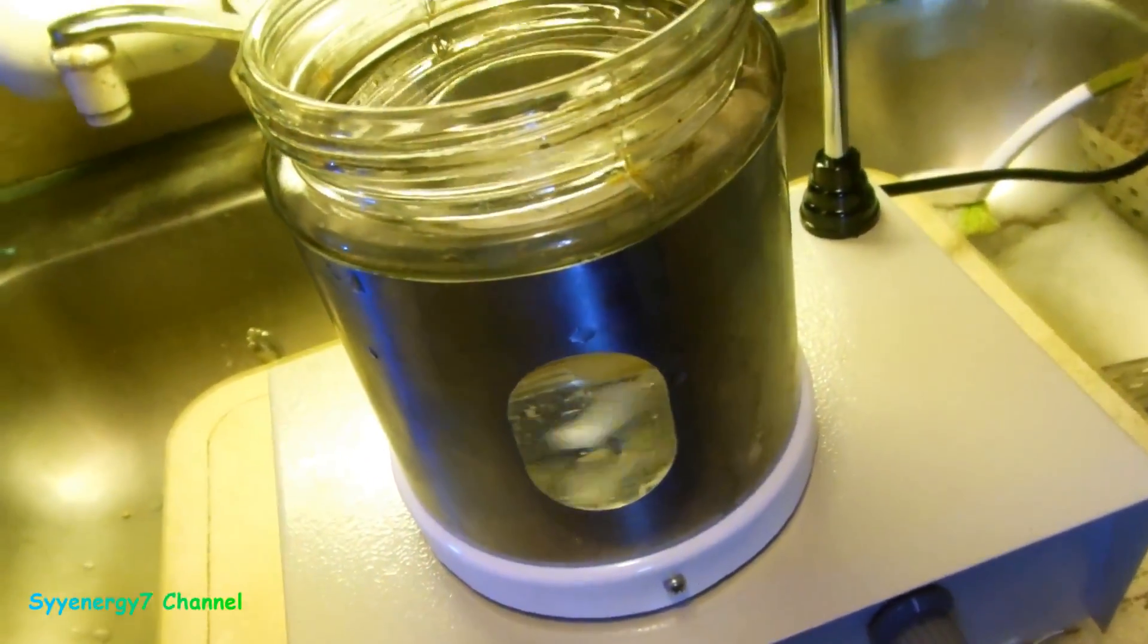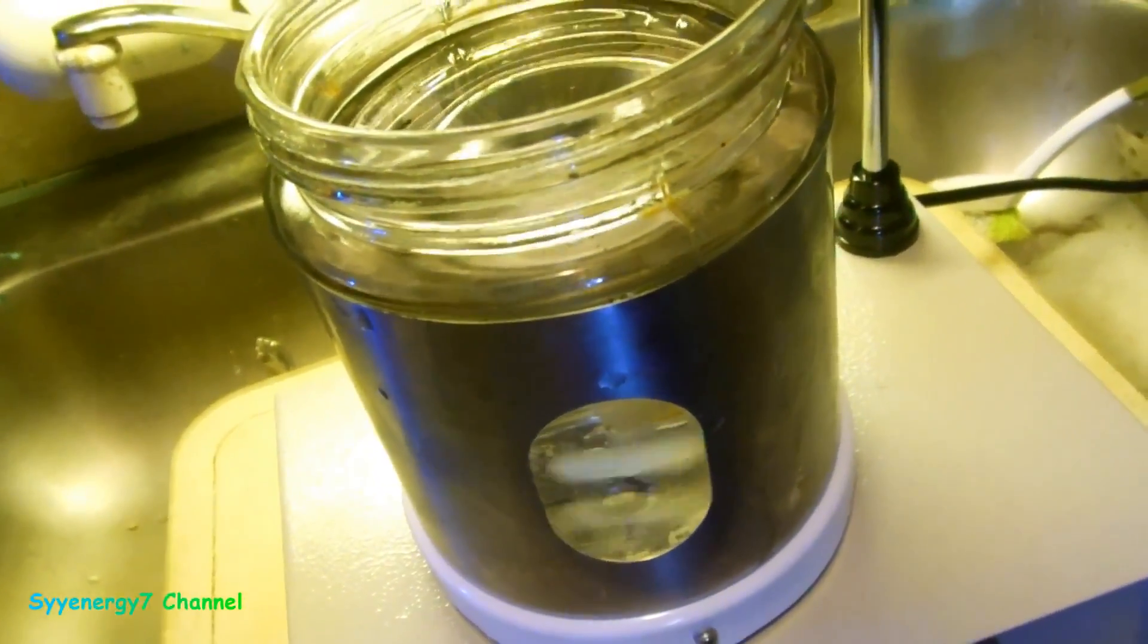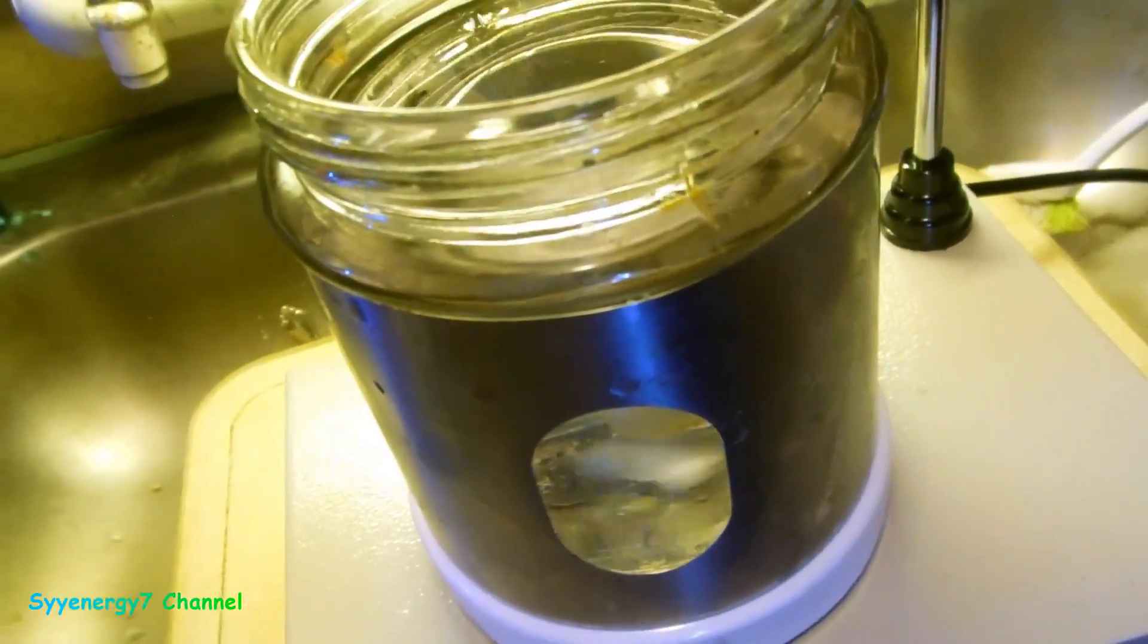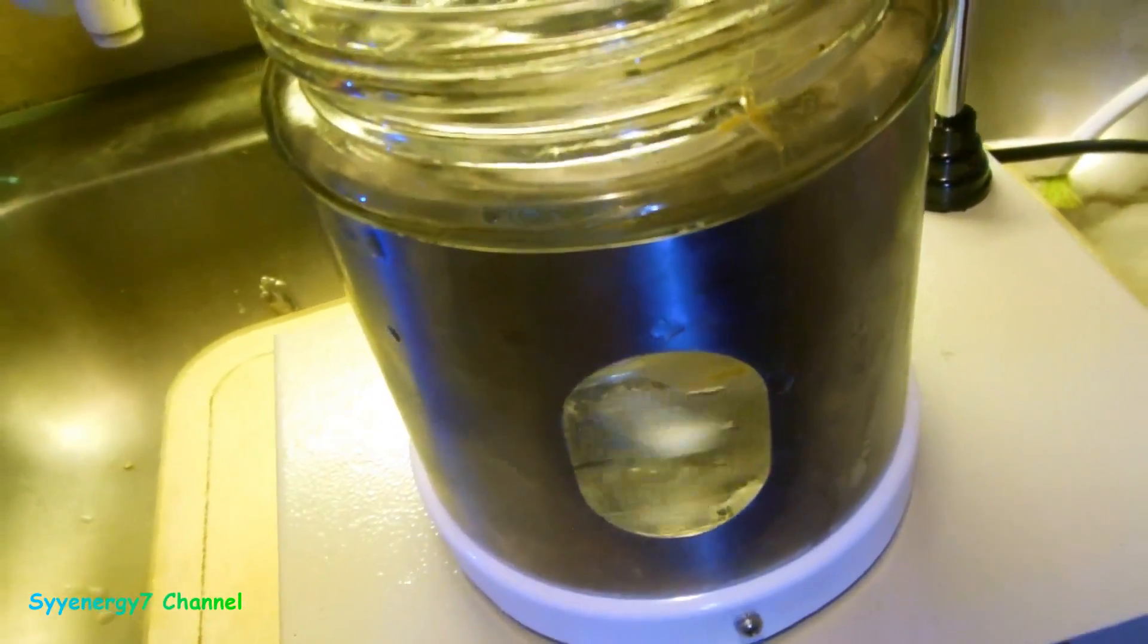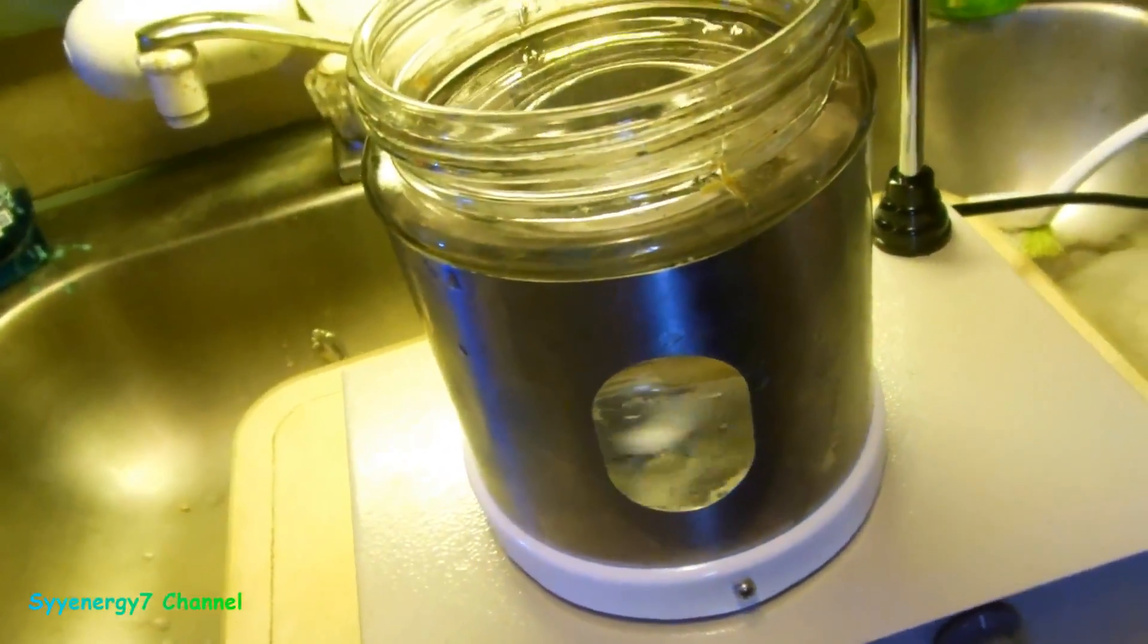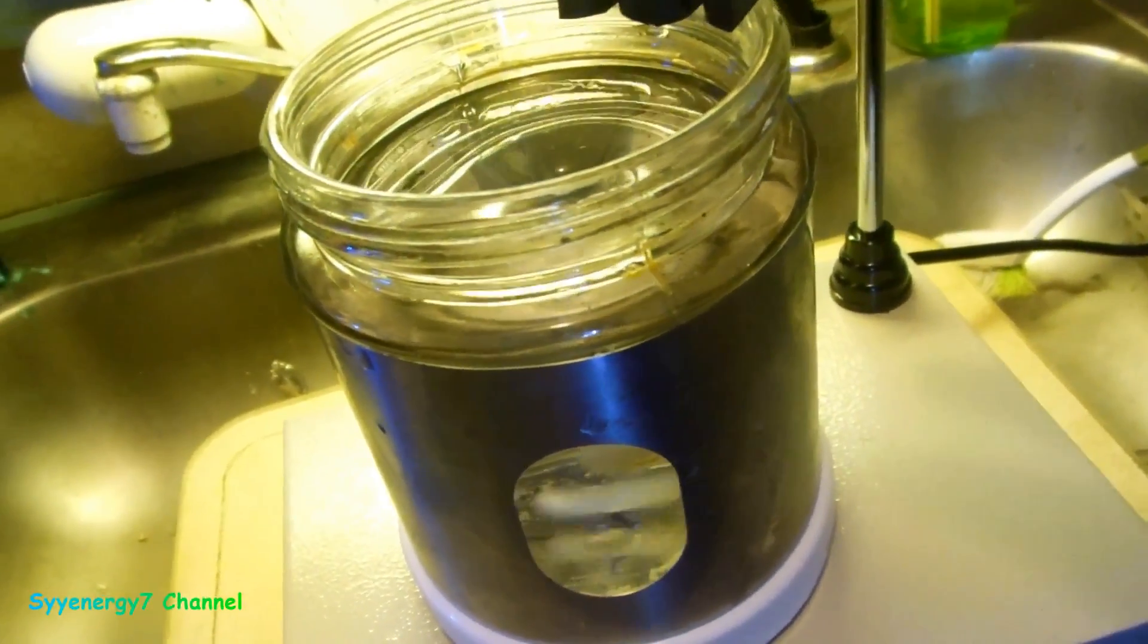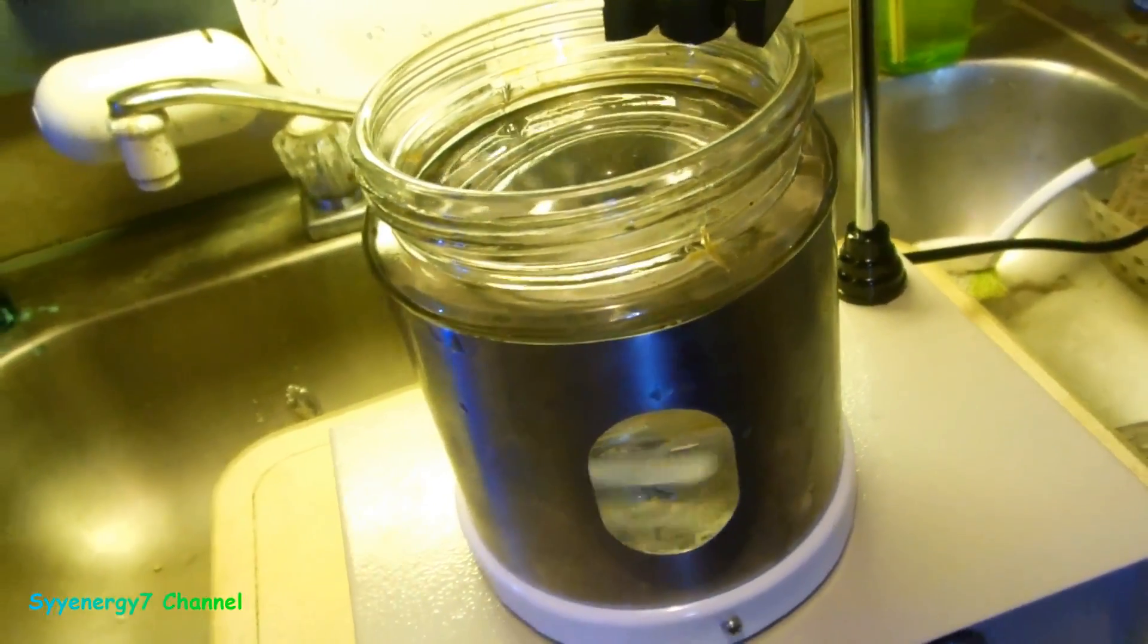So anyway, we'll be making some silver soon. But don't expect an update right away, probably take a few days. I'm probably going to start doing this today because it's going to take a couple days to make this stuff. And we'll be starting out with distilled water, not tap water like I'm demonstrating in here. We'll be using distilled water.